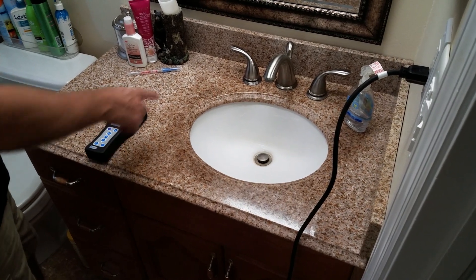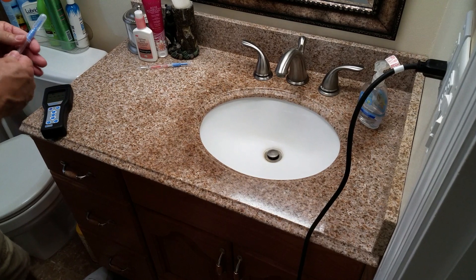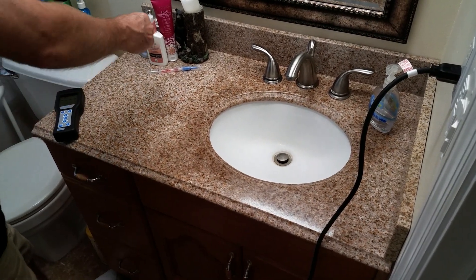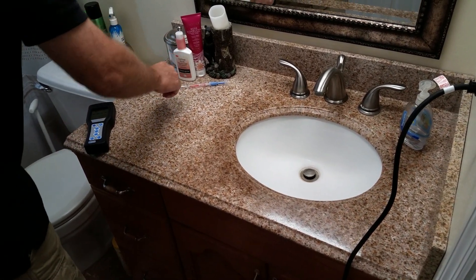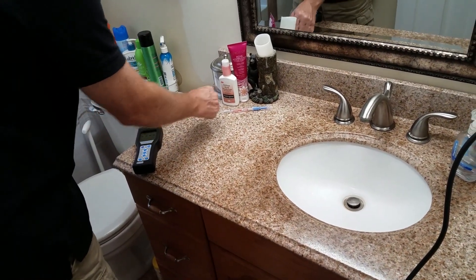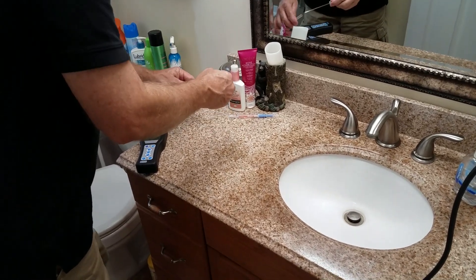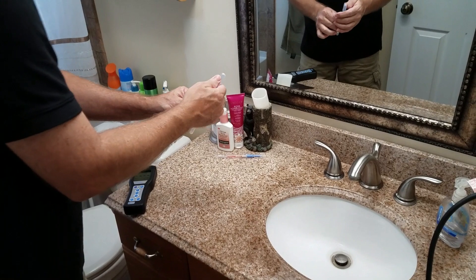Let's do a test. We cleaned some of these surfaces, but over here I want to do a quick test to see if the surface is a little bit dirty. Then we're going to show how we spray it with the electrostatic sprayer, and we'll check it when it's dry. Let's see what the bacteria count is here.